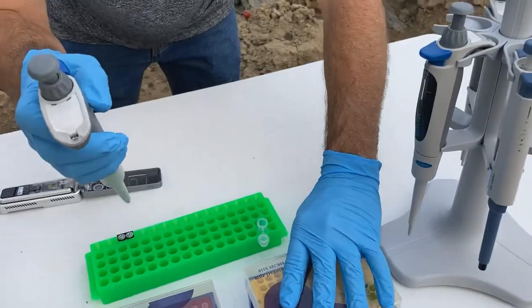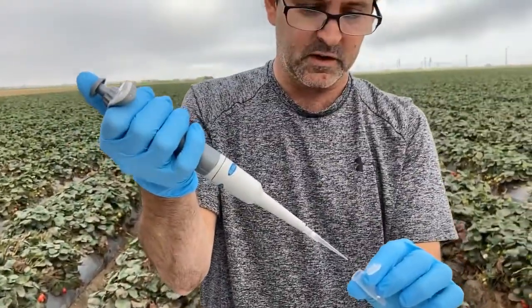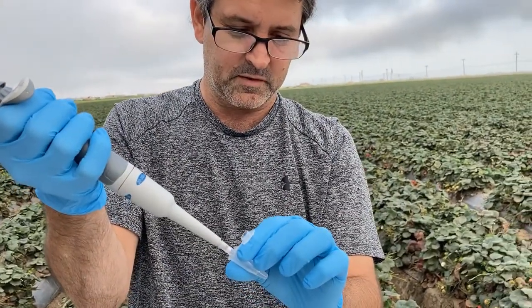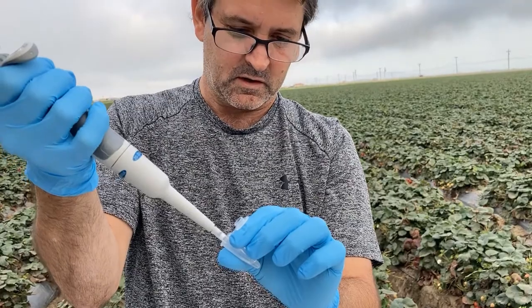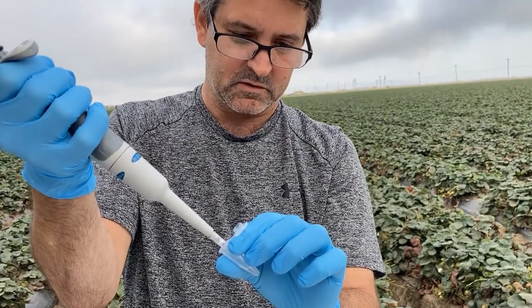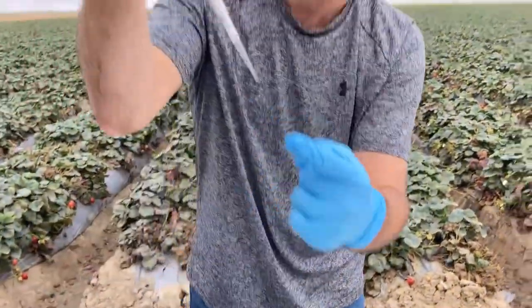Next, I'll grab my pipette tip. It's set to 120 because we had 117 of buffer and 3 of tether, so I'm just going to mix this, make sure it's good. After it's mixed, you don't want a bubble in here.